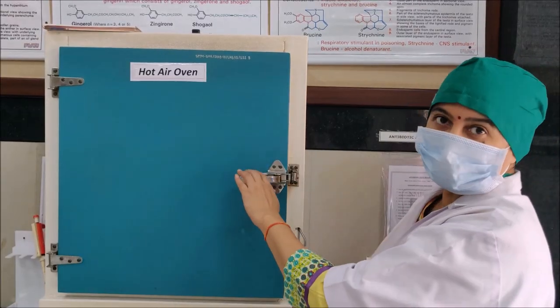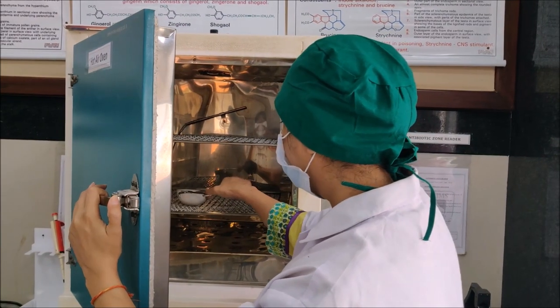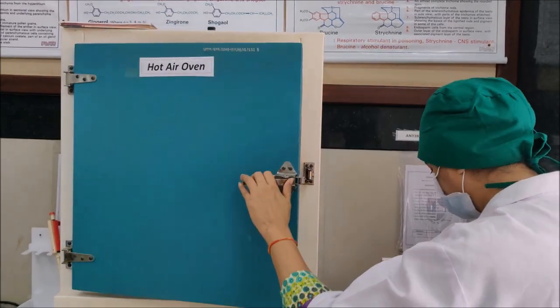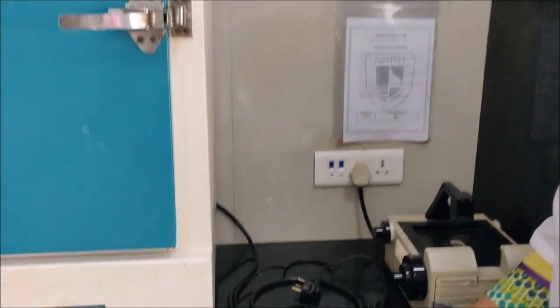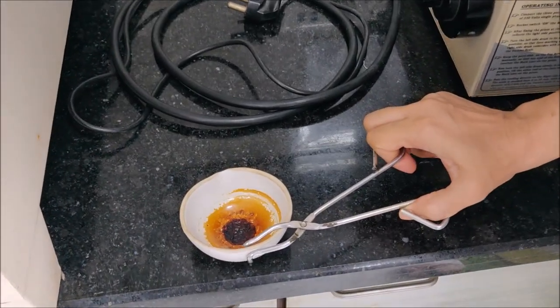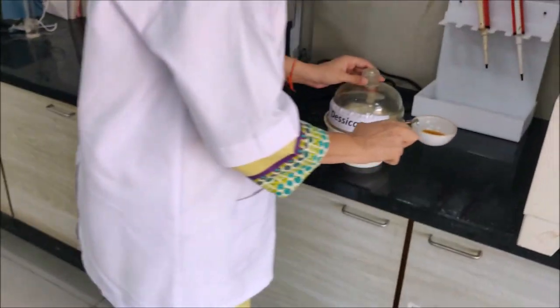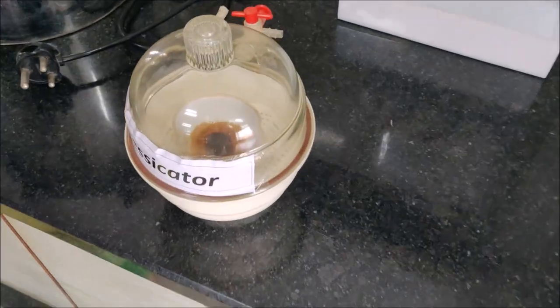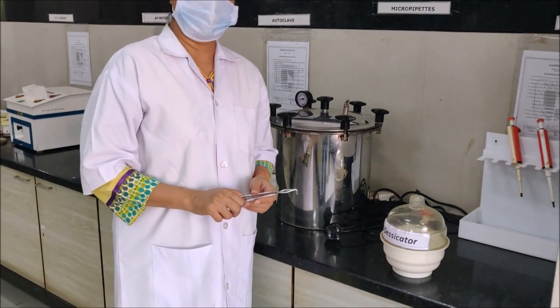Two hours are completed and now we will be taking out our sample. We will see if it is completely dry — as you can see, it is completely dry. Now we have to quickly put it in the desiccator and keep it for 30 minutes to allow it to cool. We are keeping it in the desiccator so that environmental moisture is not absorbed by the extract.